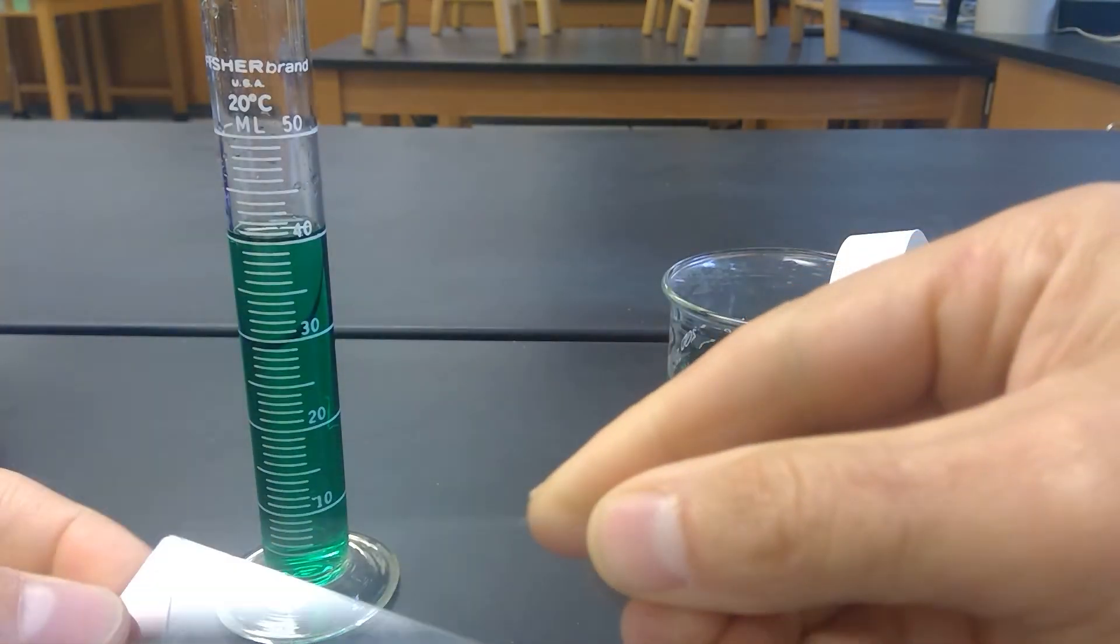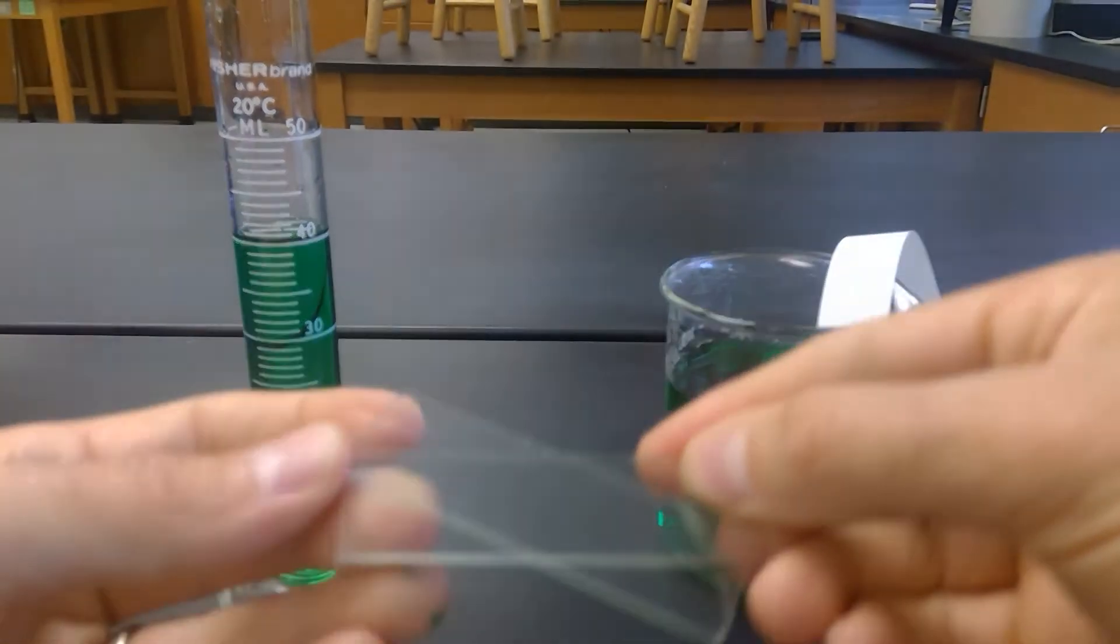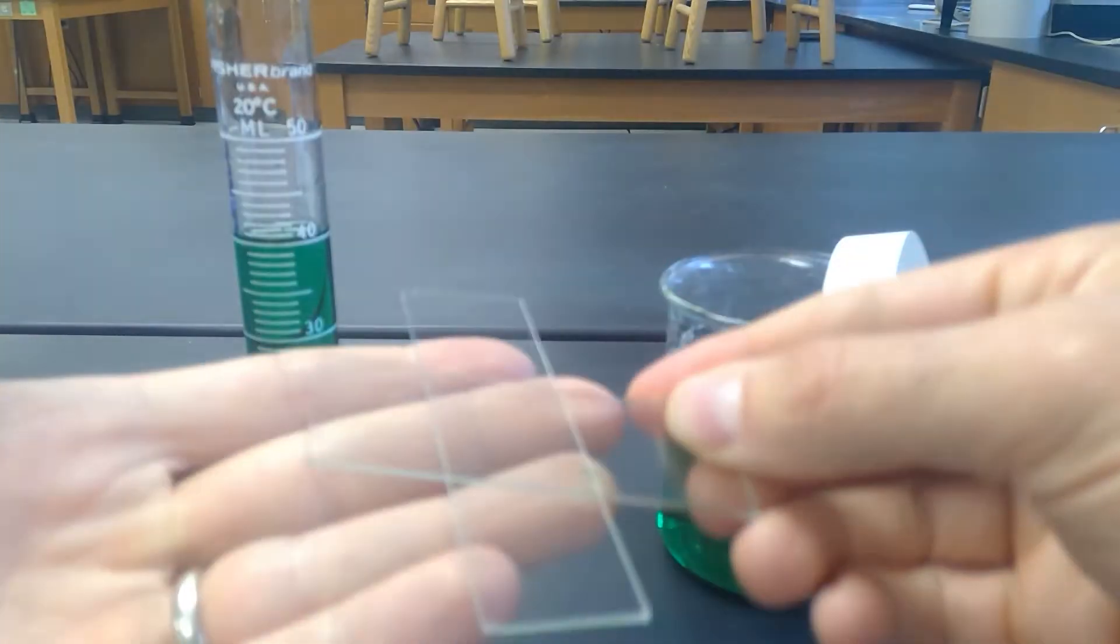Okay. So now they're a hundred percent dry. If I try to hold them together like this, you'll see they're not going to stick together.